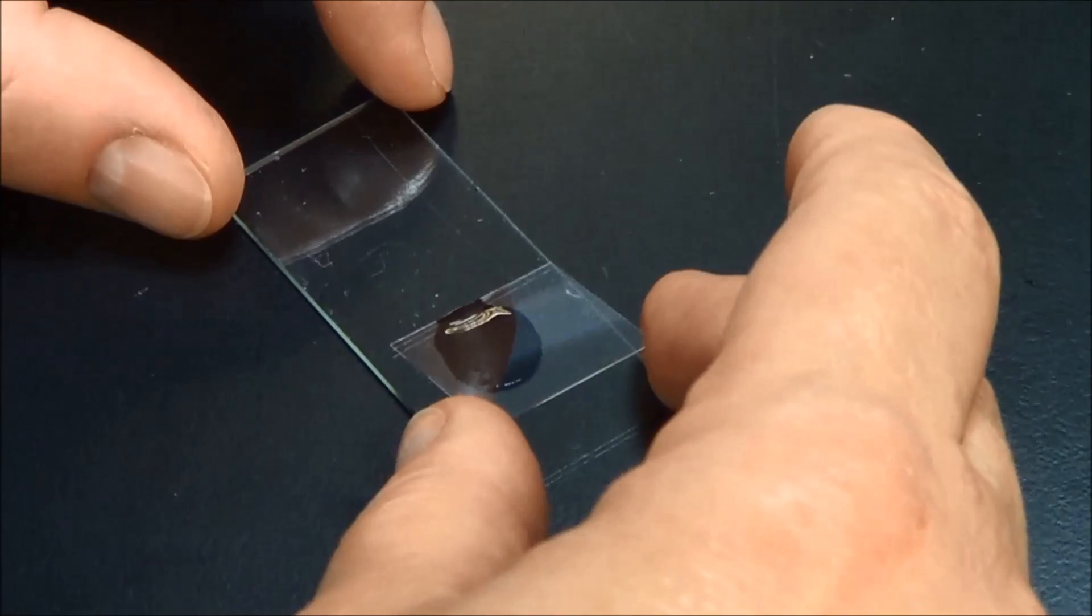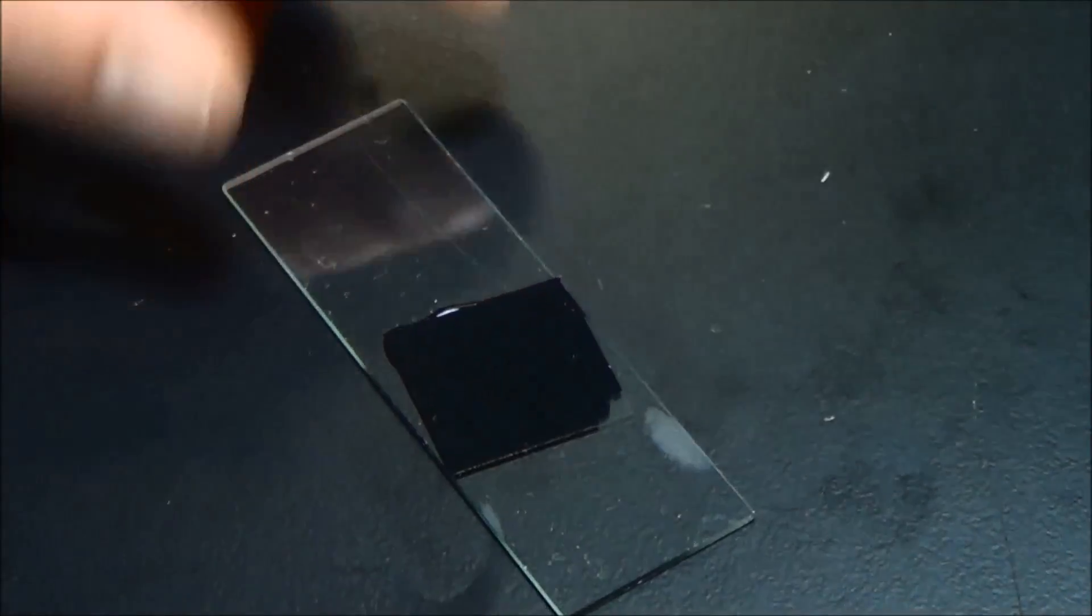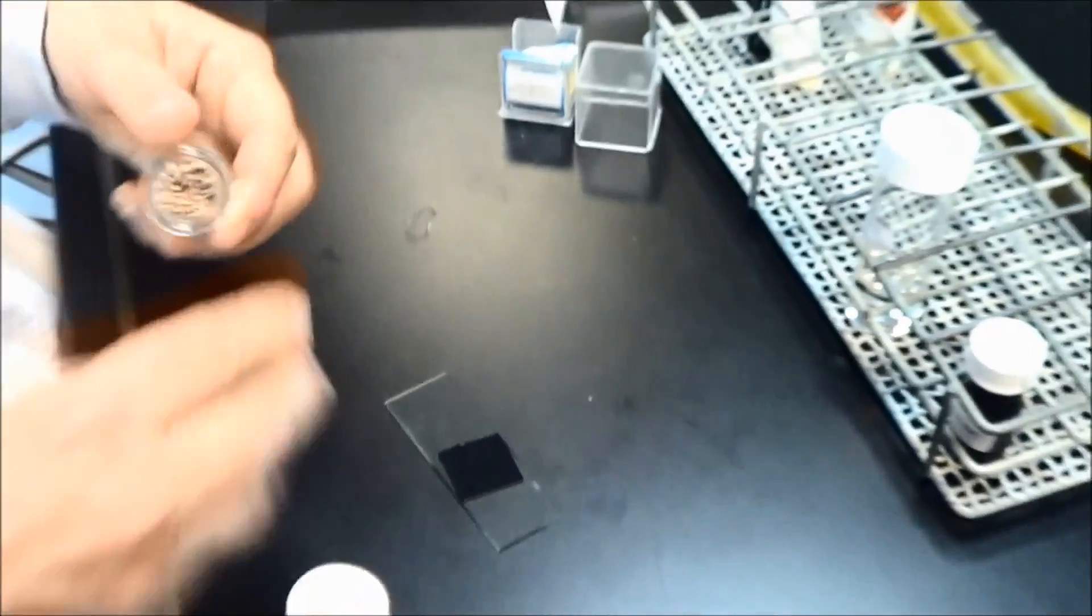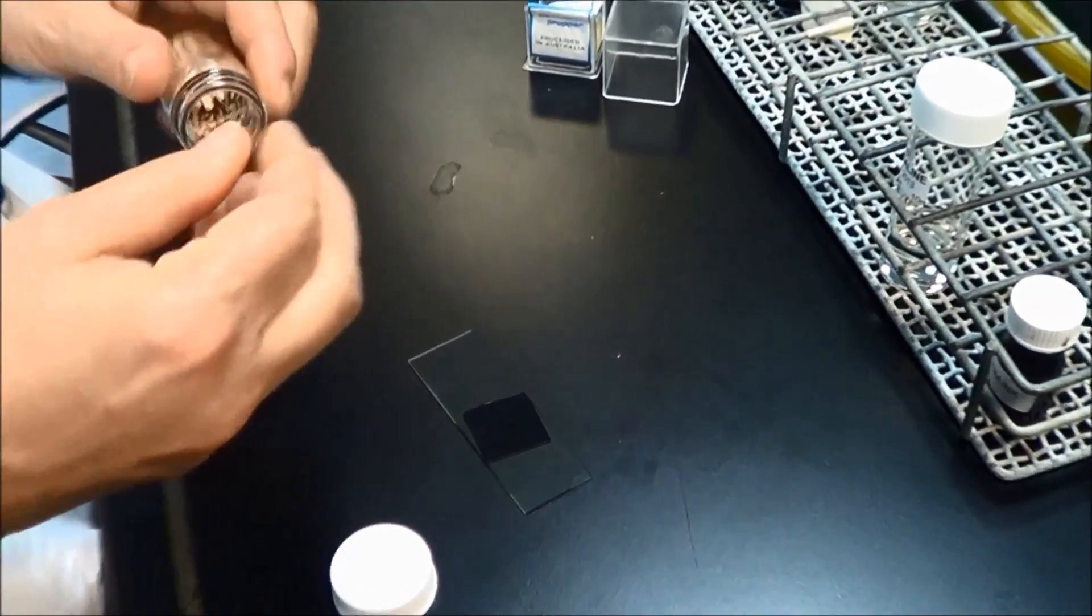Place a coverslip on the slide. With a clean toothpick, gently press down on the coverslip.